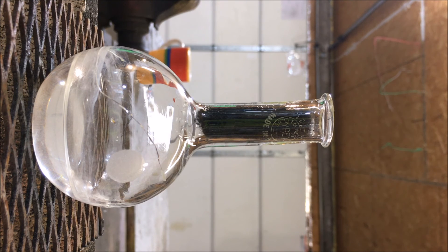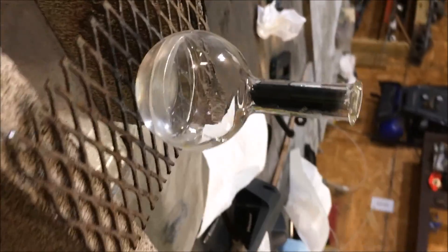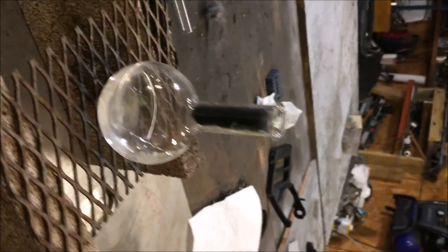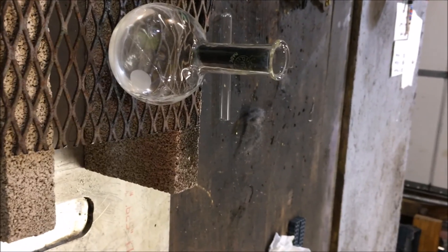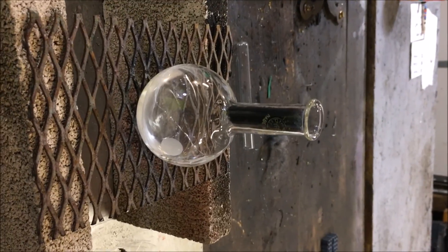Supposedly the military used this reaction to fill weather balloons in the field as well. I just wanted to see if I could get a little tiny match flame on the top of this, and I did not. I'll go ahead and post the video anyway, just because it was kind of interesting to see the attempt. Something I've been wanting to do for a long time. I don't have all the glassware I need for this, but I may attempt it one more time with a better setup.